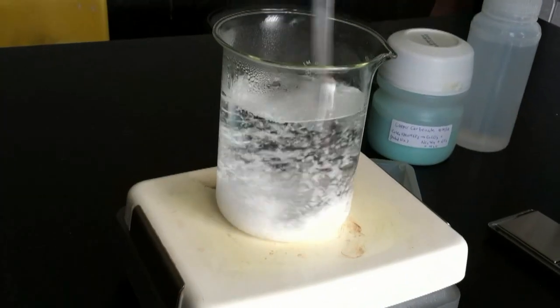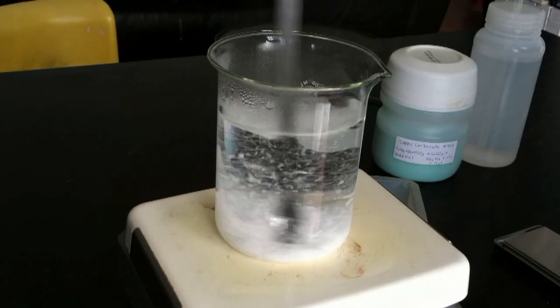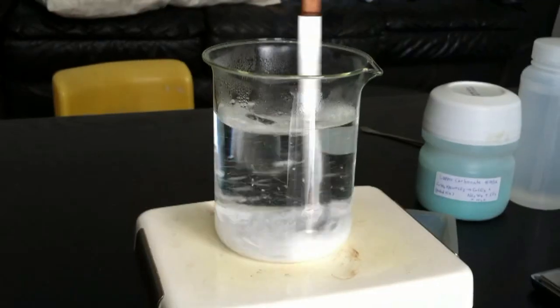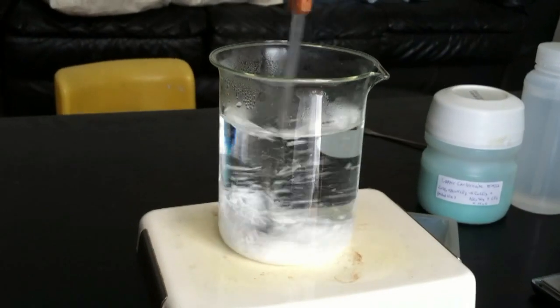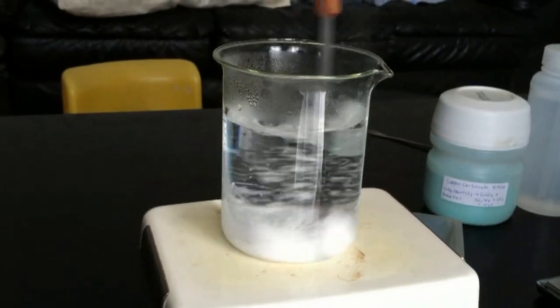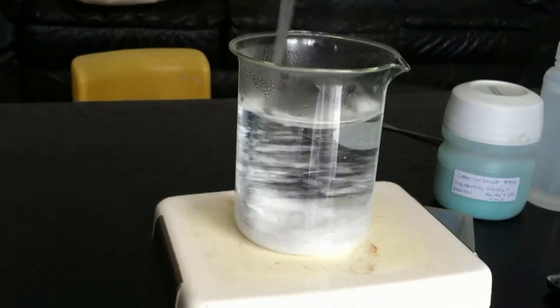Now I will be mixing it. As you can see, dissolving the benzoic acid will take quite a while. Wow, it looks like snow. Why does this thing smell so bad?